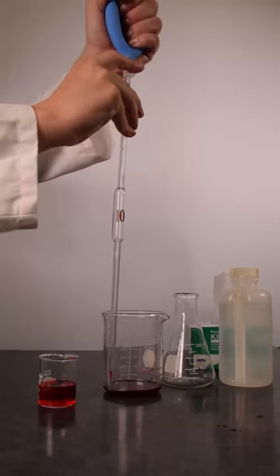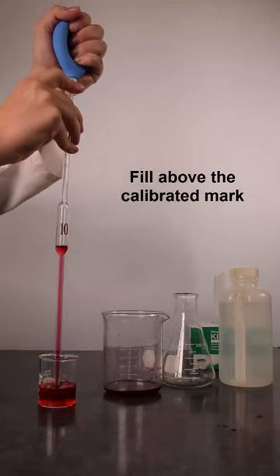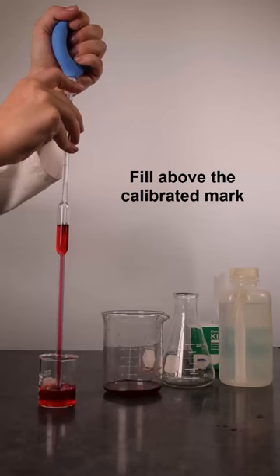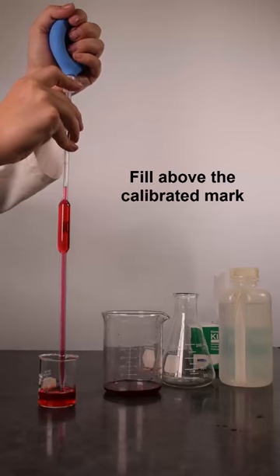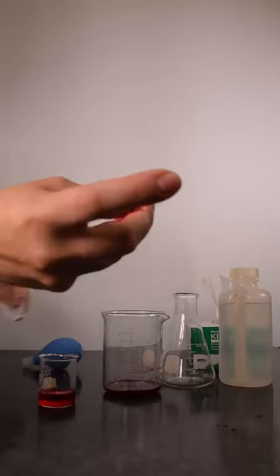After rinsing, fill the pipette above the calibrated mark using the filling technique that was used to rinse the pipette. After filling above the calibration mark, it is very important to wipe the pipette tip with a kimwipe to remove any drops on the outside of the pipette.